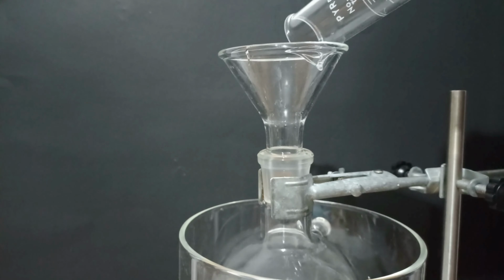I started moving and chopping the tablets with a glass stirring rod, and after some minutes, with a stir bar. I then set up things into reflux.